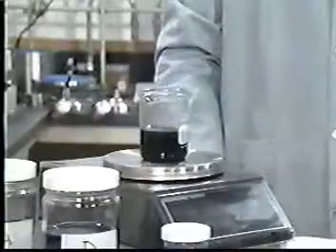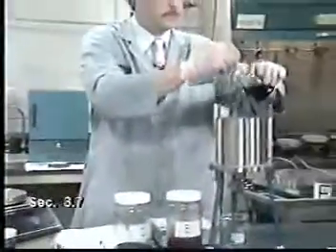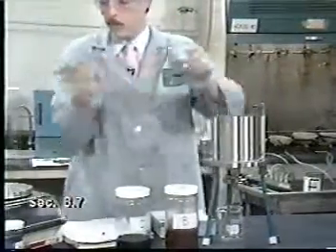Slurries should be allowed to stand so that solid contents will settle. This will aid in the filtration process. Centrifugation is another useful aid. If it is used, decant and filter the liquid first, followed by filtration of the solid through the same apparatus. If more than 1% of the sample has adhered to the walls of the transfer container, measure the amount and subtract it from the sample weight to be filtered.